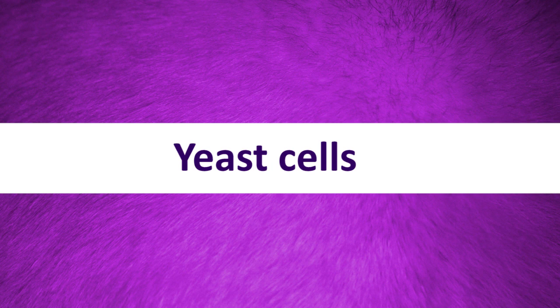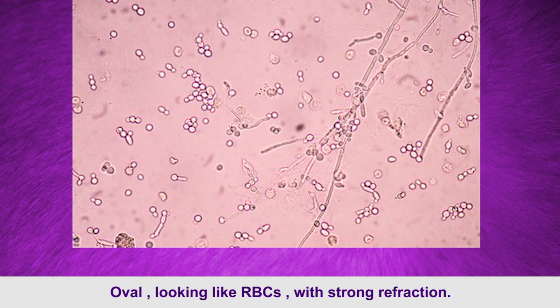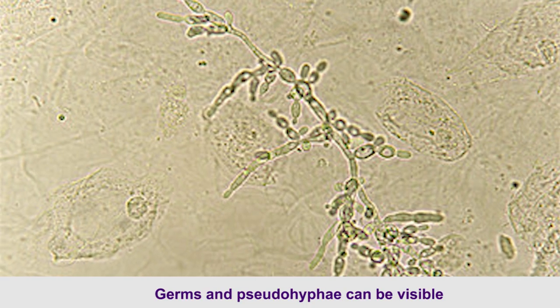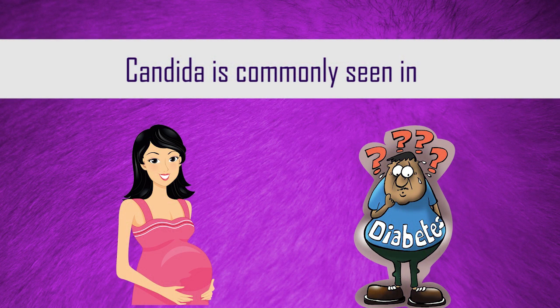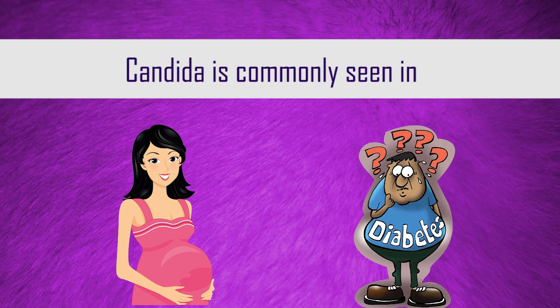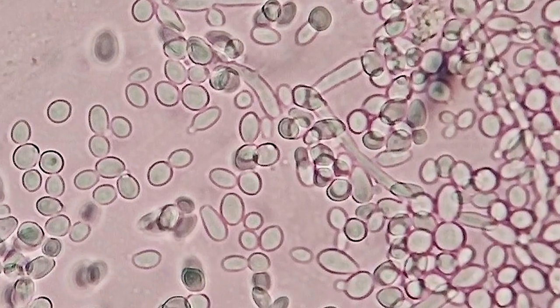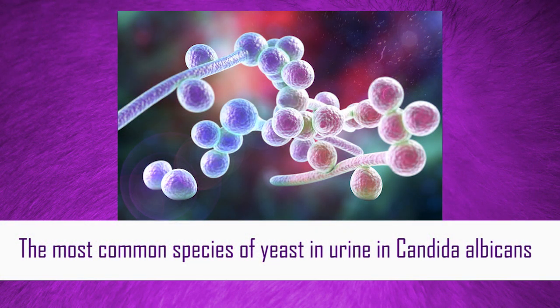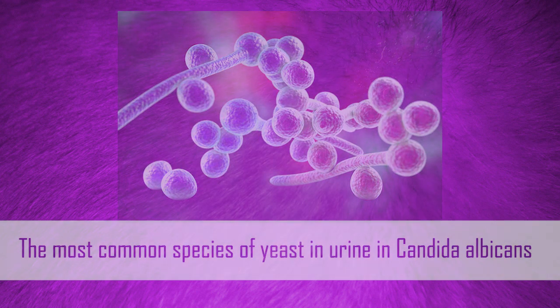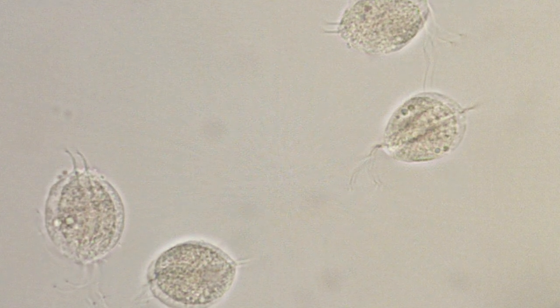Yeast cells are oval-shaped, looking like red blood cells, with strong refraction. Pseudohyphae can be visible. They are commonly found in the urine of pregnant women, diabetic patients, or in alkaline urine infections. They may also occur in urine of immune-deficient or immunosuppressed patients. The most common species of yeast in urine is Candida albicans. Trichomonas vaginalis is considered a sexually transmitted disease and is flagellate.